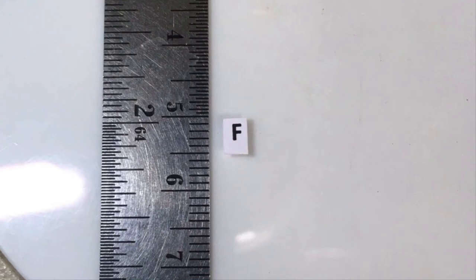In the column of image observed with naked eye in the lab report, draw the letter F that you see.